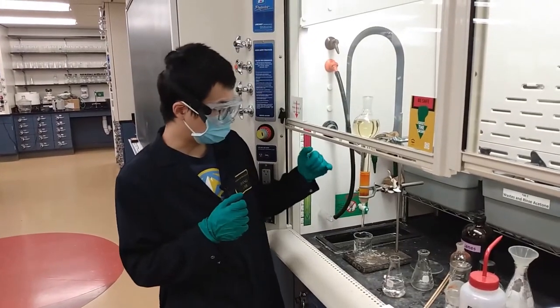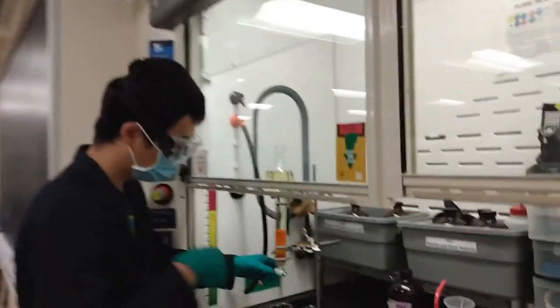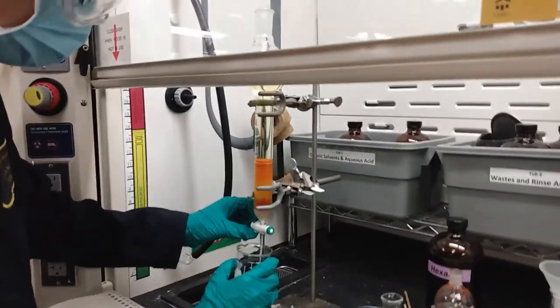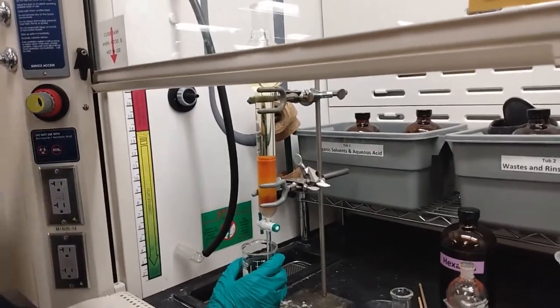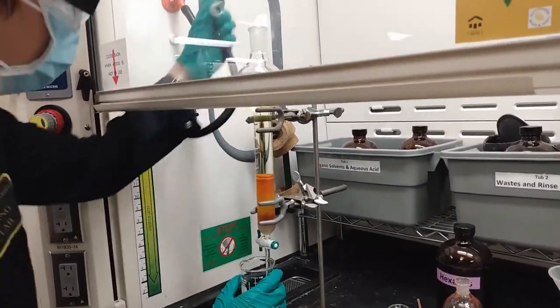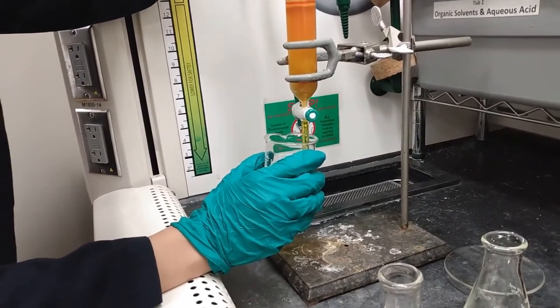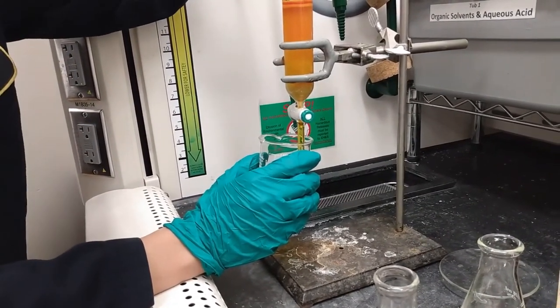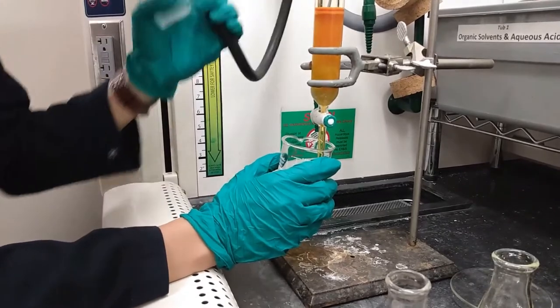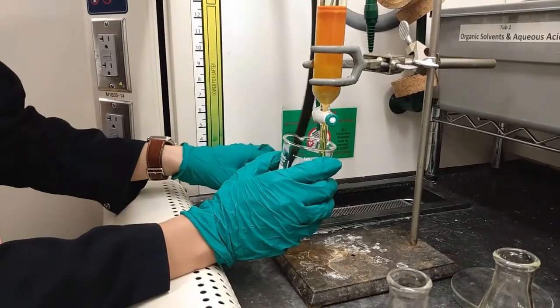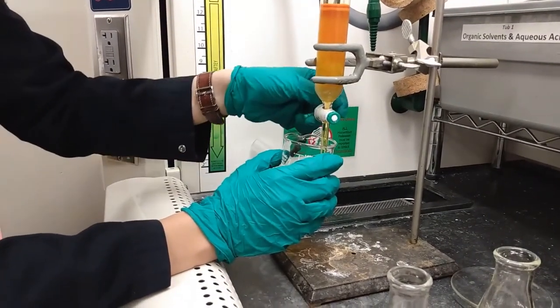We got the red band at the bottom, so just keep going. We can use a beaker or an Erlenmeyer flask to collect this portion. Now it's pretty much done. We got the stuff collecting here.